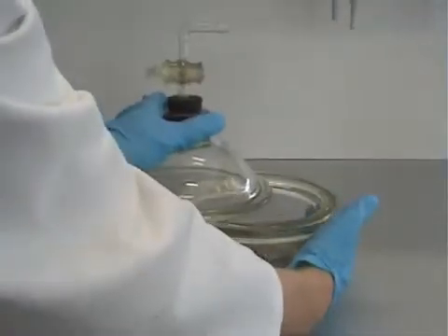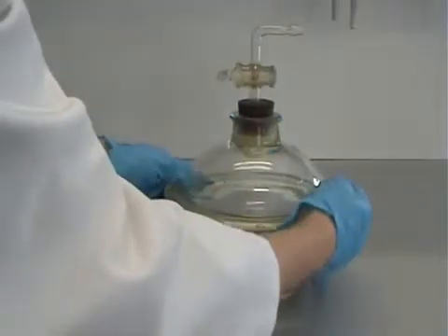The lid should then be slid onto the top of the desiccator, ensuring the seal is complete all the way around.